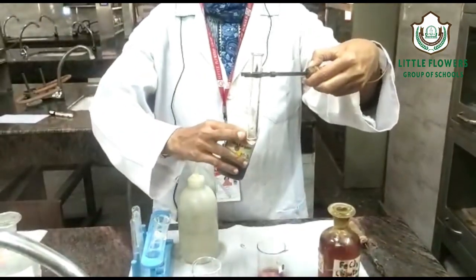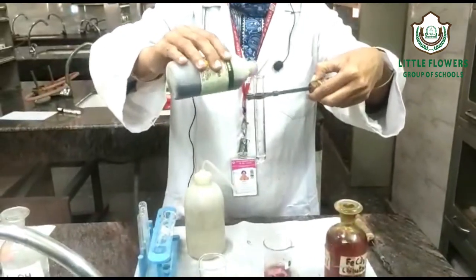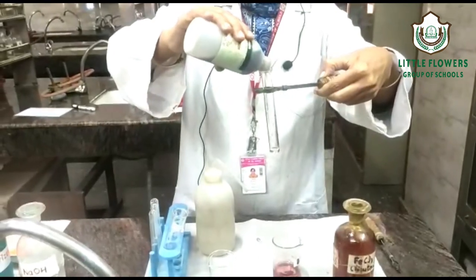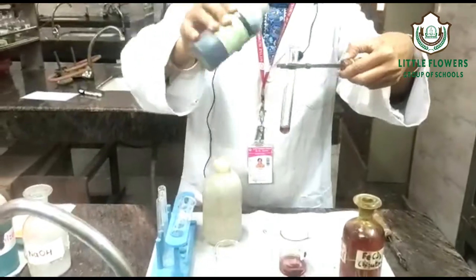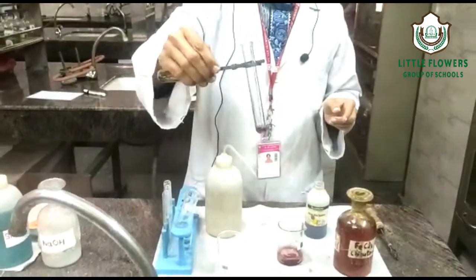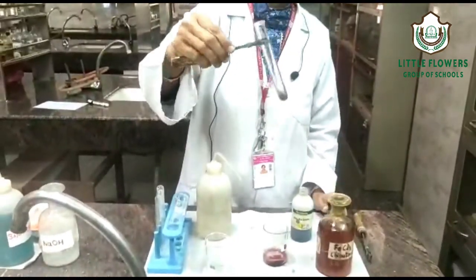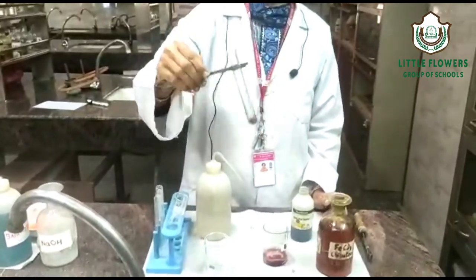We have taken the organic compound in a test tube and added a few drops of litmus solution. See the change — yes, it has changed red in color. So it is acidic in nature.